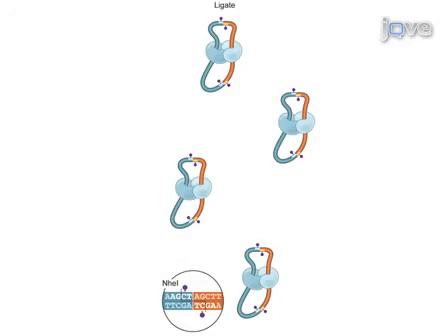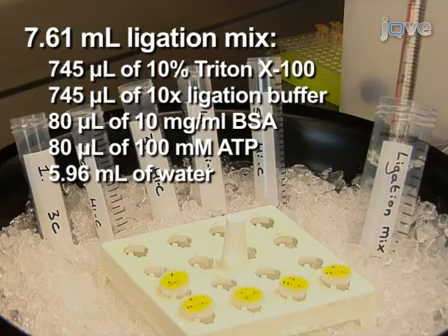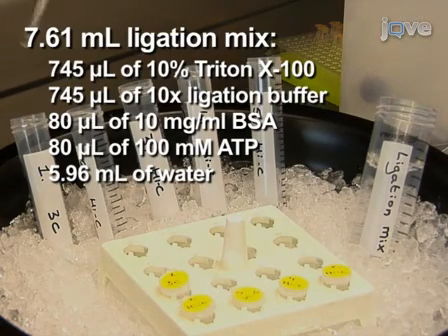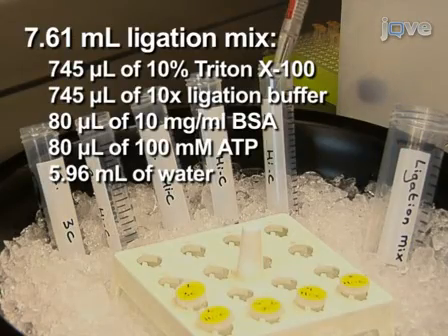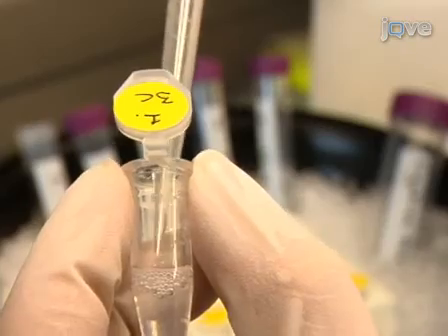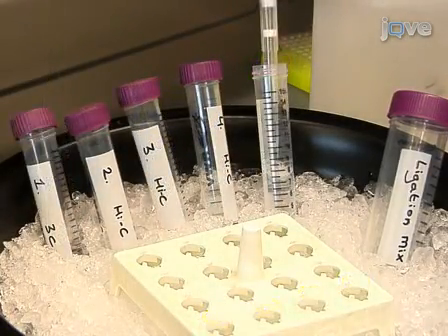To favour ligation events between cross-linked fragments, the ligation is performed under extremely dilute conditions. Working on ice, add 7.61 milliliters of ligation mix to each of 5 15 milliliter tubes. Then, transfer each digested chromatin mixture to the corresponding tube.